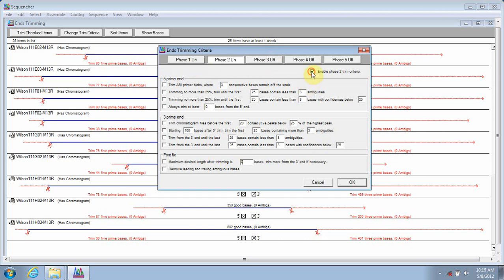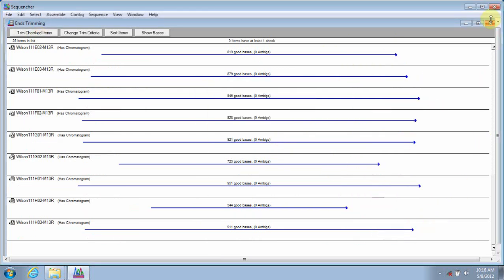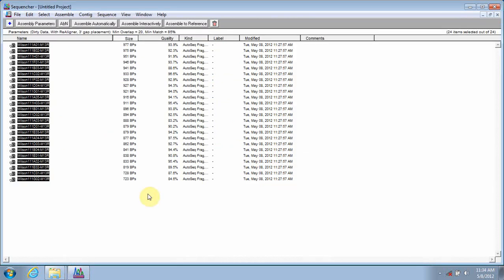Now for this project, I'm going to go ahead and leave most default trim parameters in place, simply change the confidence level on the 5' end and on the 3' end. I'll hit OK. It's going to go ahead and loosen up what's being trimmed off, basically off of the 3' end. I'm going to go ahead and hit trim checked items, and there we have what's been trimmed off. I can close, view the greatly increased quality scores. Looking at an average overall quality increase of about 15 to 20%.